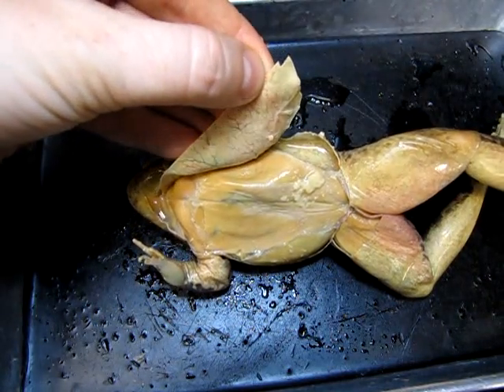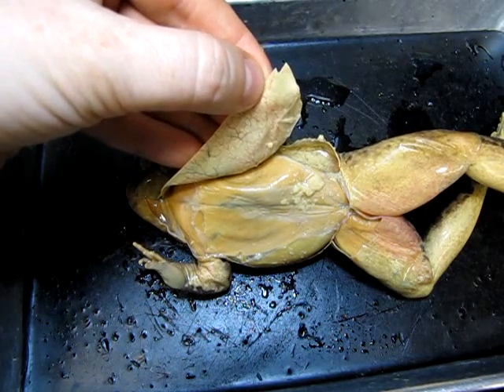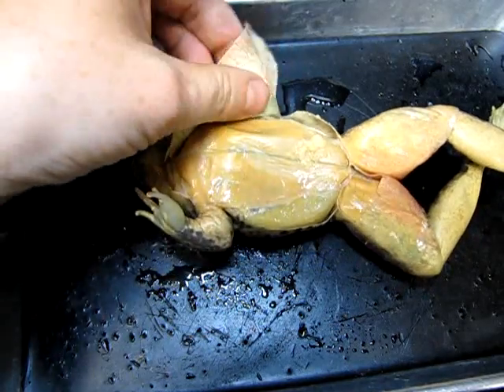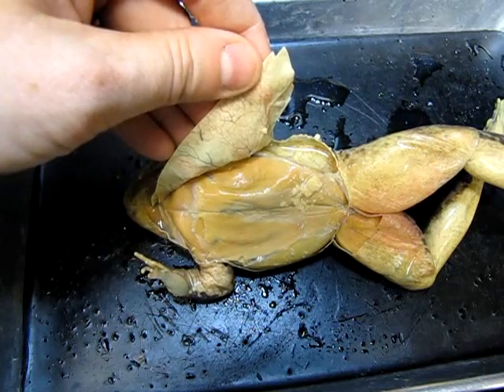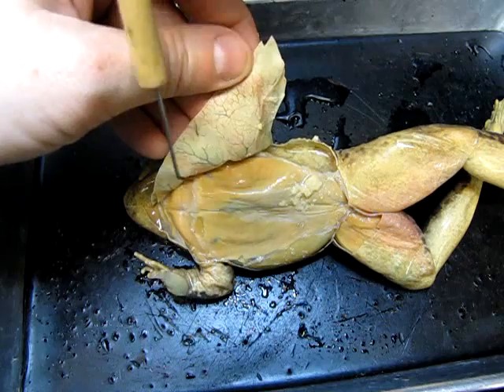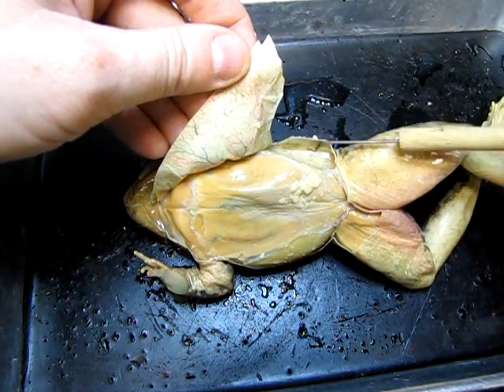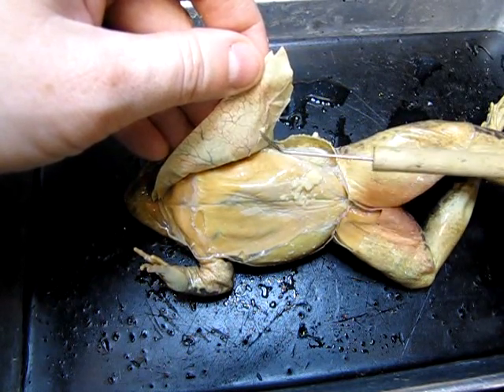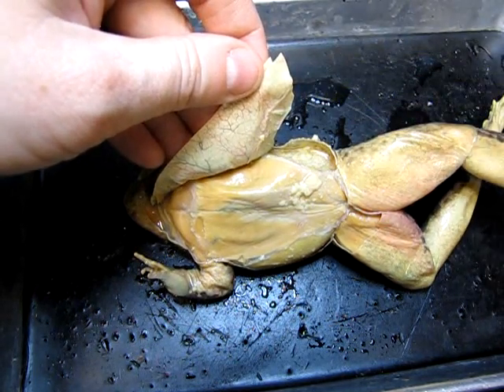On the skin itself — on the flap that I'm holding here — you can see all those squiggly little lines of different colors. This animal has been injected with colored latex so we can see different structures. All of those lines are little veins and capillaries lining the underside of the skin. Going back to the idea that amphibians are able to breathe underwater through the surface of their skin, you can see how highly vascularized the skin is in order to facilitate that oxygen exchange.